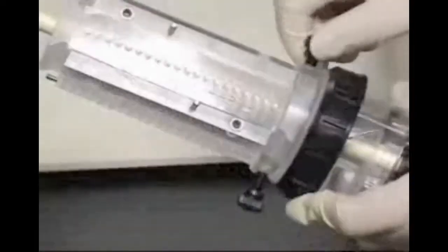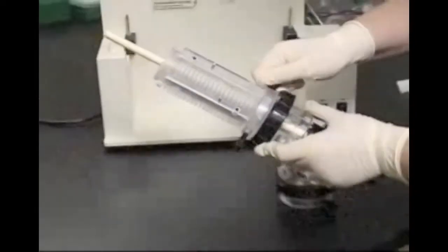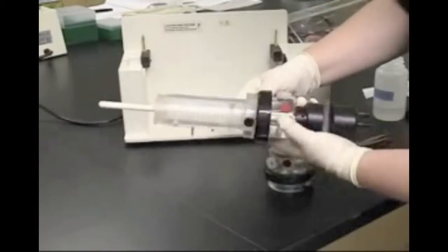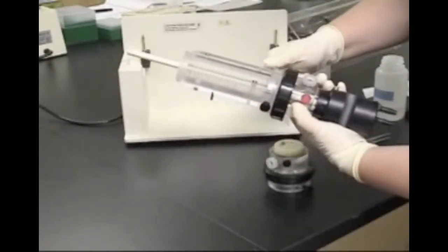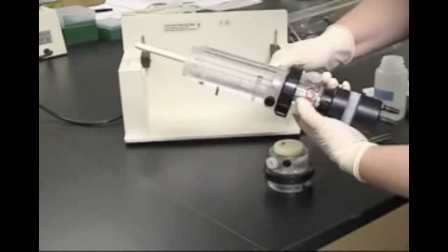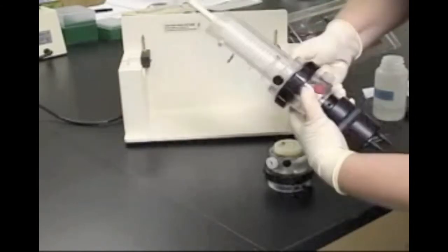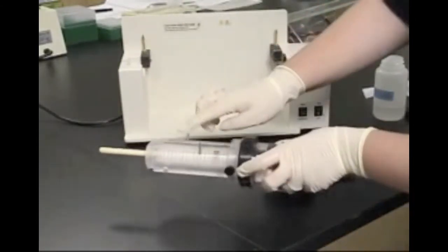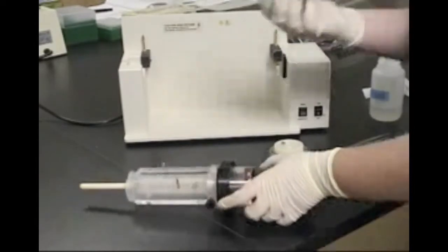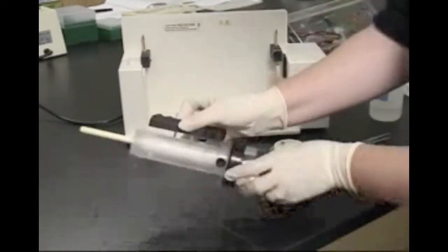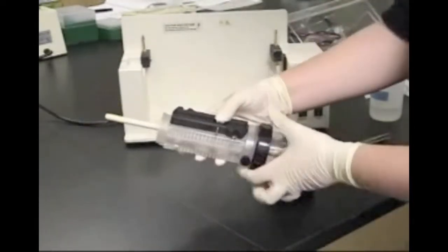Once the focusing chamber is in place and correctly aligned with the membrane core, tighten the black retaining screws and check the alignment once again. Reinforce the taped ports with one of the two black acrylic cell cover blocks and tighten the screws.